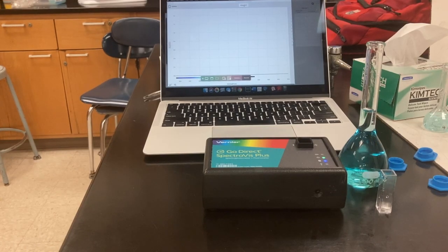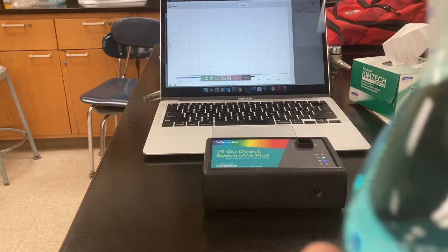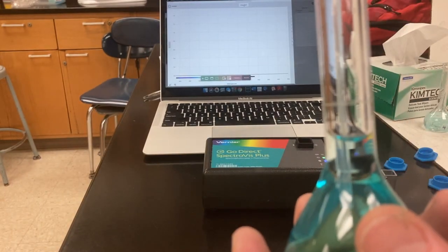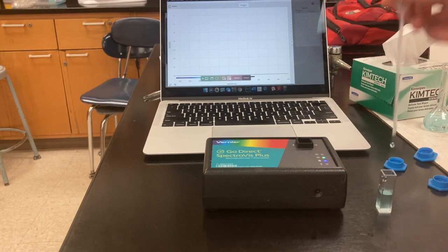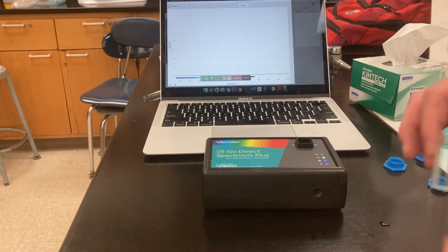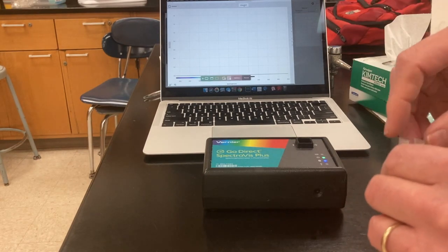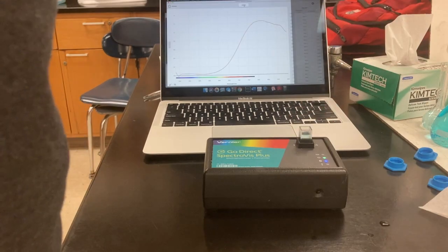And now the last thing to do is to take the absorbance of a sample of the solution that has my brass dissolved in it. So remember, the volume is 100 milliliters. I'm taking enough to fill the cuvette to catch the light as it goes through the spectrophotometer. Like always, I'm going to make sure that I don't have any bubbles inside or any droplets outside that would change the path of the light. And I take my reading.